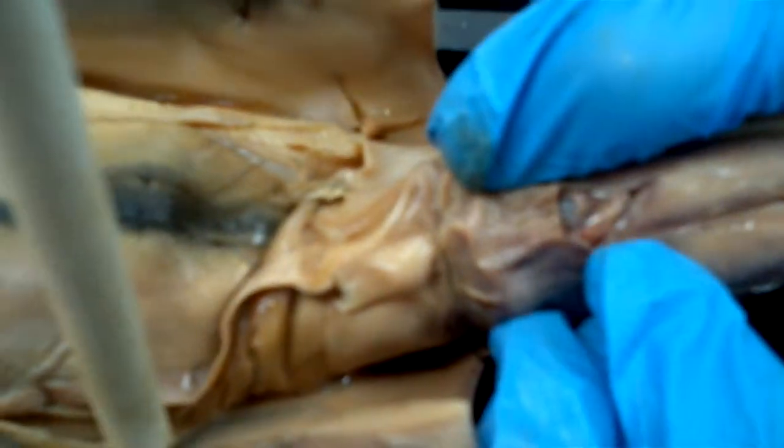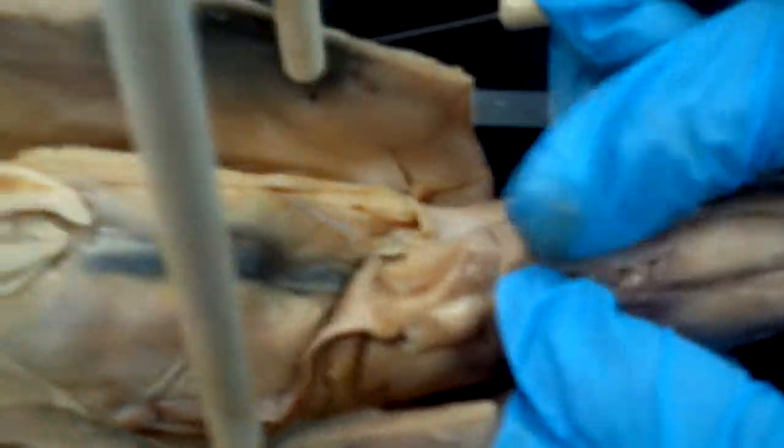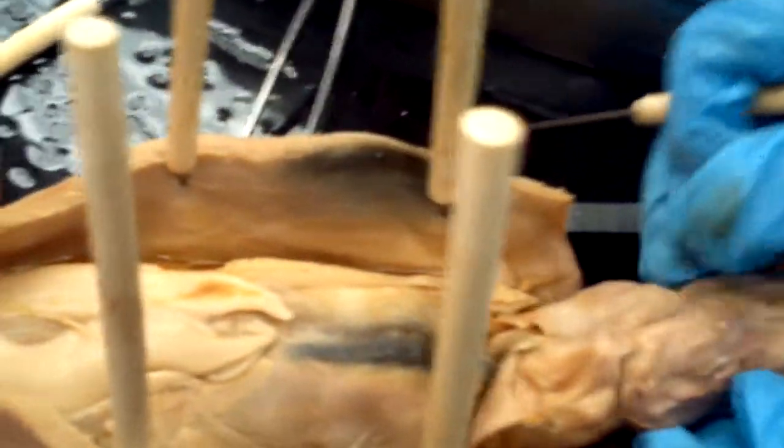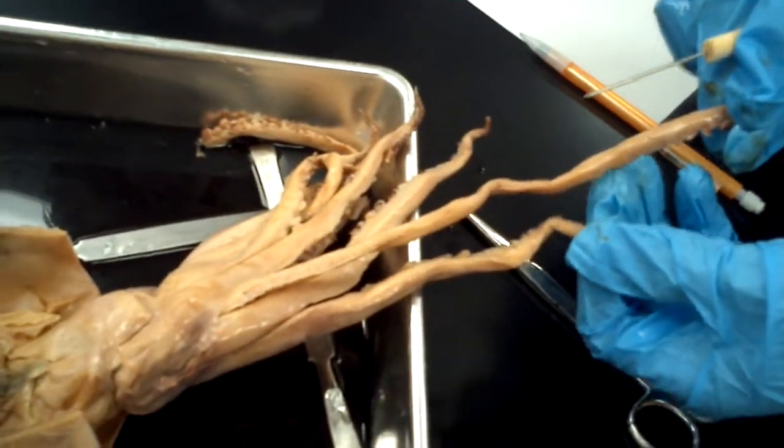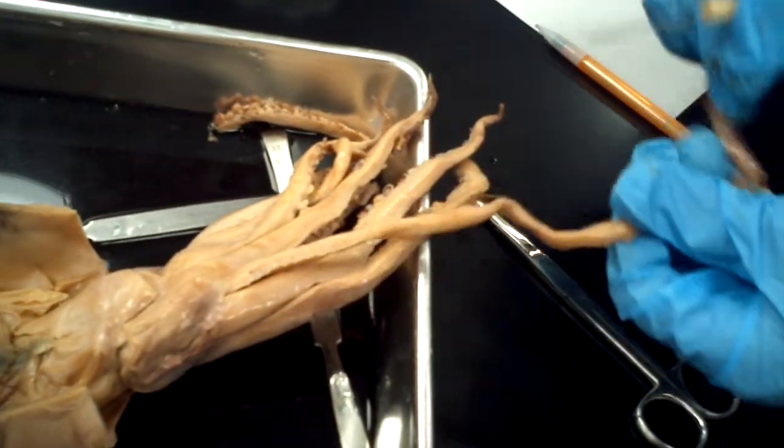Yeah, can you see the eye? Yeah, it's right there. Pretty much like what everybody else is doing. So the tentacles are always longer than the arms. You can see — these are the tentacles. How many tentacles?